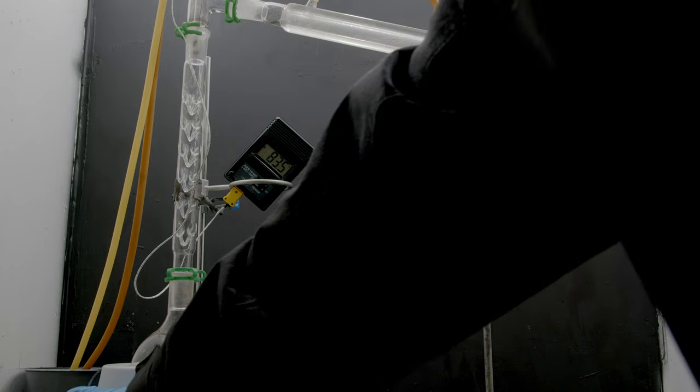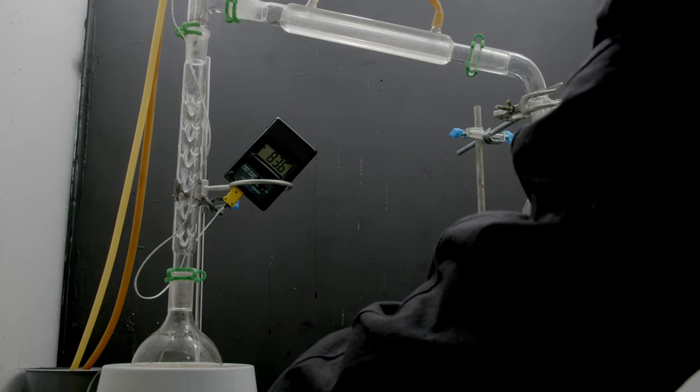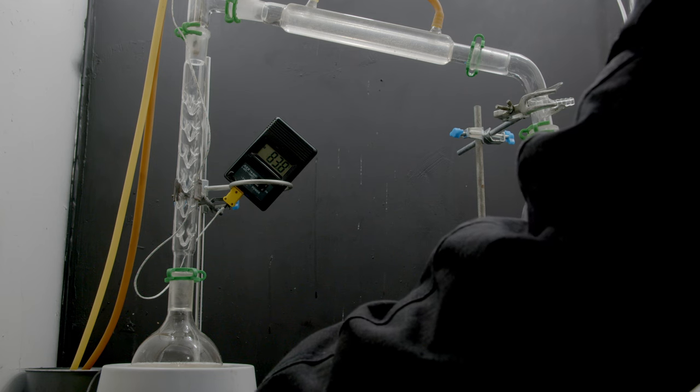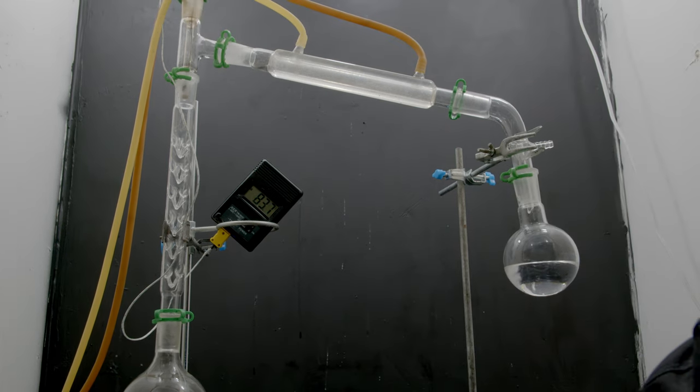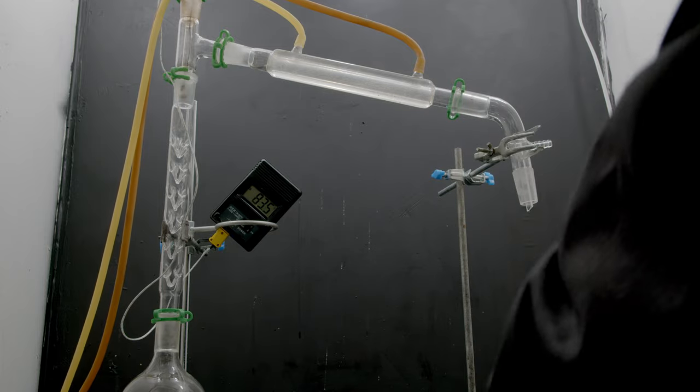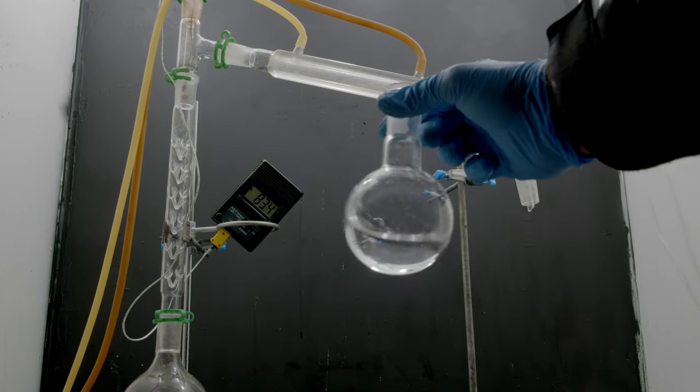Now at about 85 degrees I decided to call it. Just because the further you push it, the more water you're going to start to get, which is no bueno. Now when I tested it based off of density it was close enough to 95%, so we're going to go on to the next step.